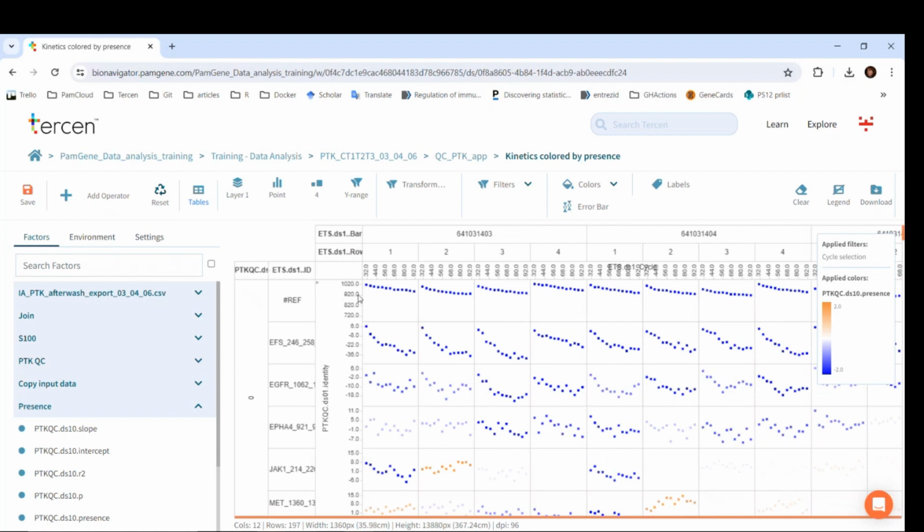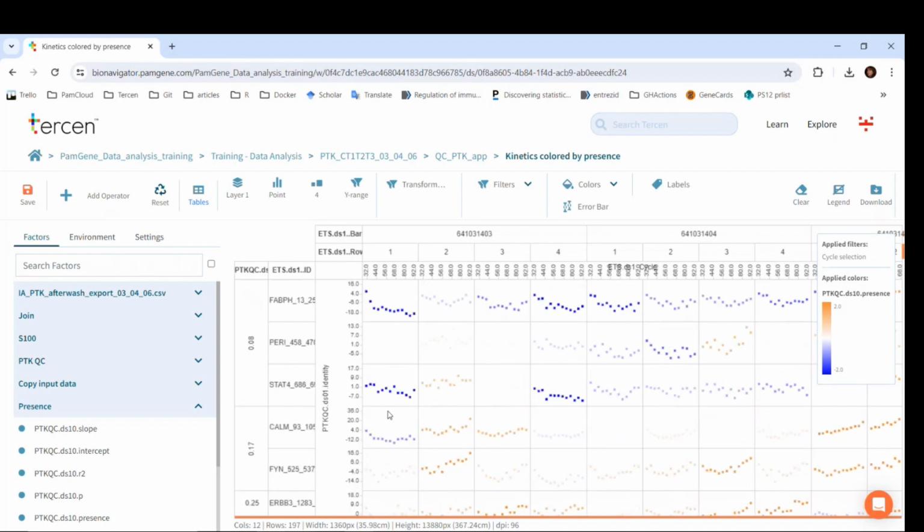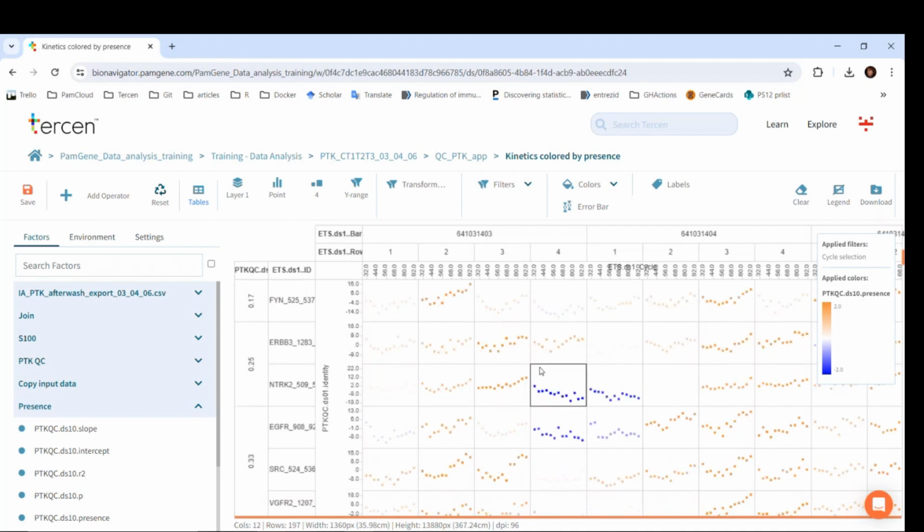First, it calculates a presence value for each peptide S100 value per barcode and row. The presence value is positive if peptide signal shows positive trend in time, so throughout the cycles. The cycles are added as the x-axis below barcode and row. Here we can see what is the trend of the S100 values through time or cycles. Orange values mean positive presence, and you can see that those peptides that show a positive trend are orange, while no trend or downward trend is colored blue. Those peptides are not present.